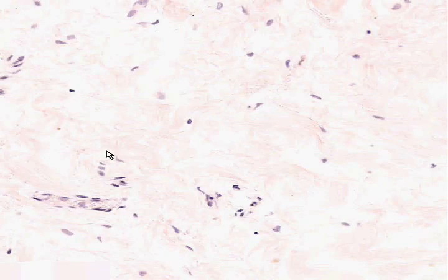Can you see the waviness of these collagen fibers here? Do you see how they go every which way? Do you see how there are areas which look like there appears to be a lack of fibers, but in some areas, like perhaps here, which I hope we can see pretty soon, there will be adipose tissue as well. So that would be another evidence that we're dealing with loose, irregular connective tissue. Another name for loose, irregular connective tissue is areolar connective tissue, and that's exactly what we're looking at here.